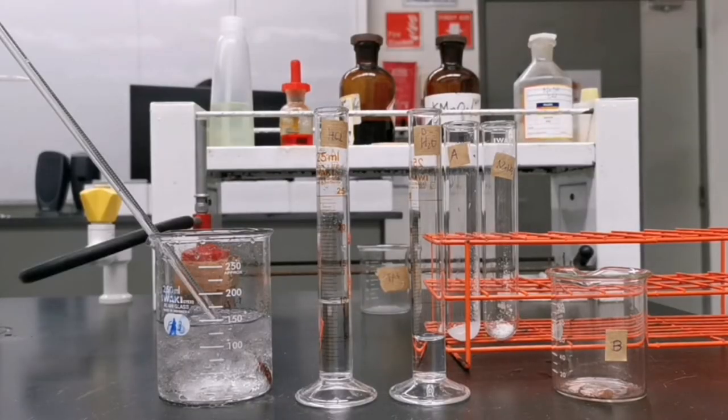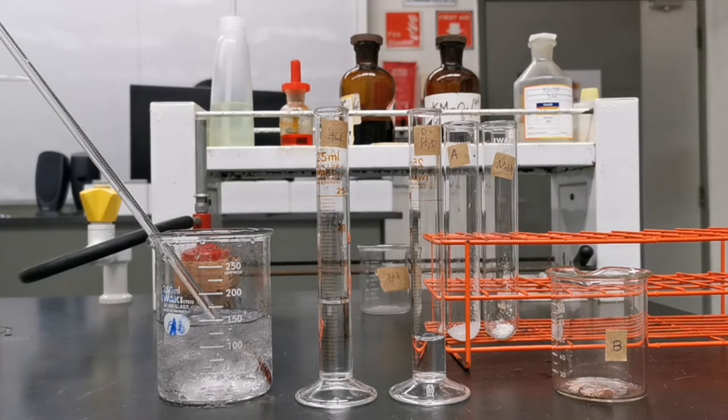So these are the materials from left to right: I have an ice bath maintaining the temperature around 5 degrees, 10 mls of hydrochloric acid, 5 mls of distilled water, 2 boiling tubes each containing ethyl-4-amino benzoate and sodium nitrite respectively each with 0.25 grams, and the beaker containing 0.50 grams of 2-naphthol. I will also be using 5 mls of sodium hydroxide solution at the later steps.